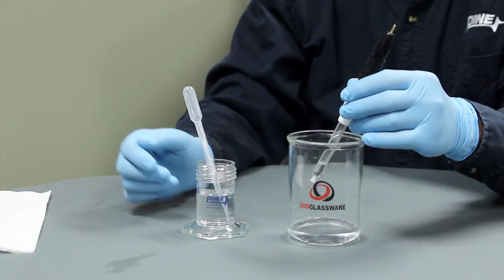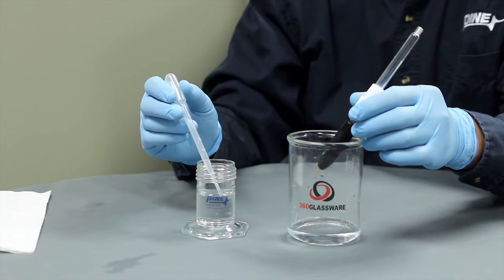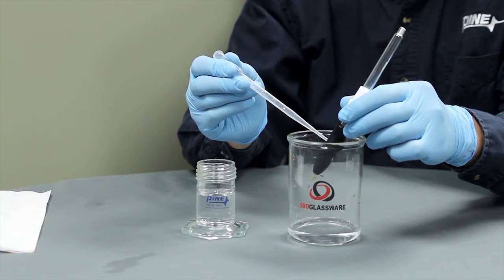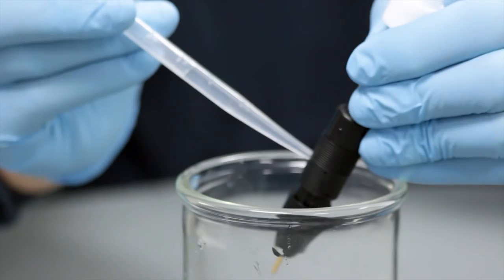Here are some tips for changing the filling solution. First, you should invert the glass tube body. Second, drain the solution using a pipette with a plastic tip. You'll place the plastic tip into the fill hole in the plastic cap.